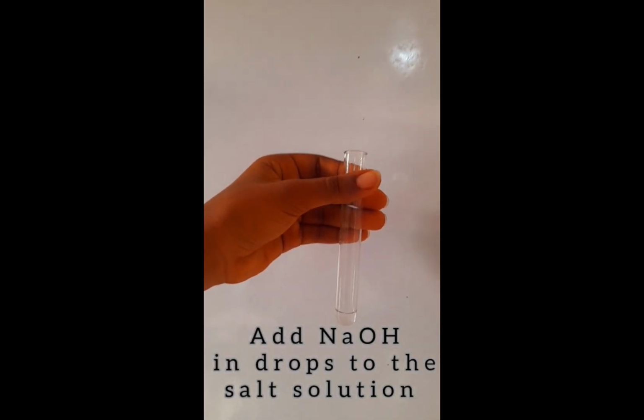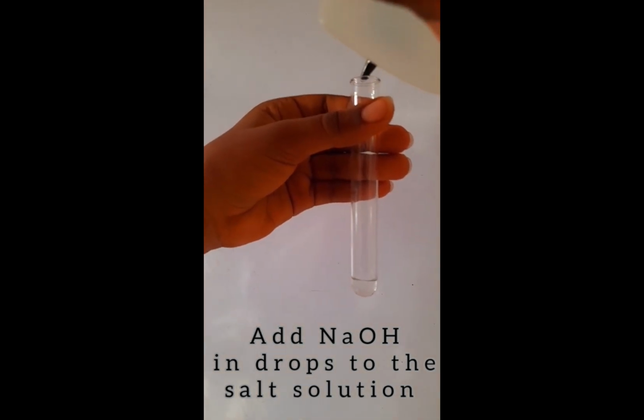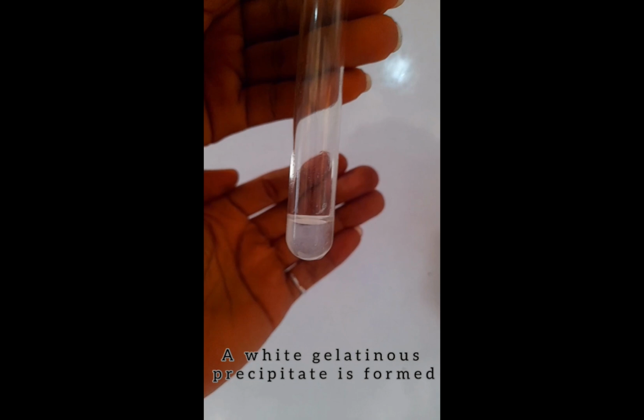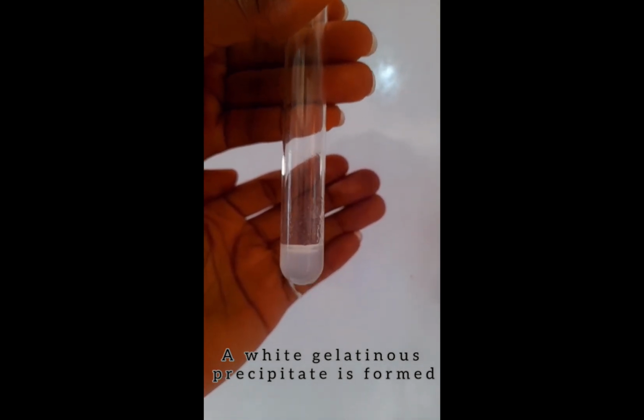So the first part we're going to test with sodium hydroxide. We'll add sodium hydroxide in drops into this solution, and you will see that a white precipitate will be formed. You can see that clearly, and it's gelatinous. So a white gelatinous precipitate is formed. See how it is, as though it sticks to the walls.